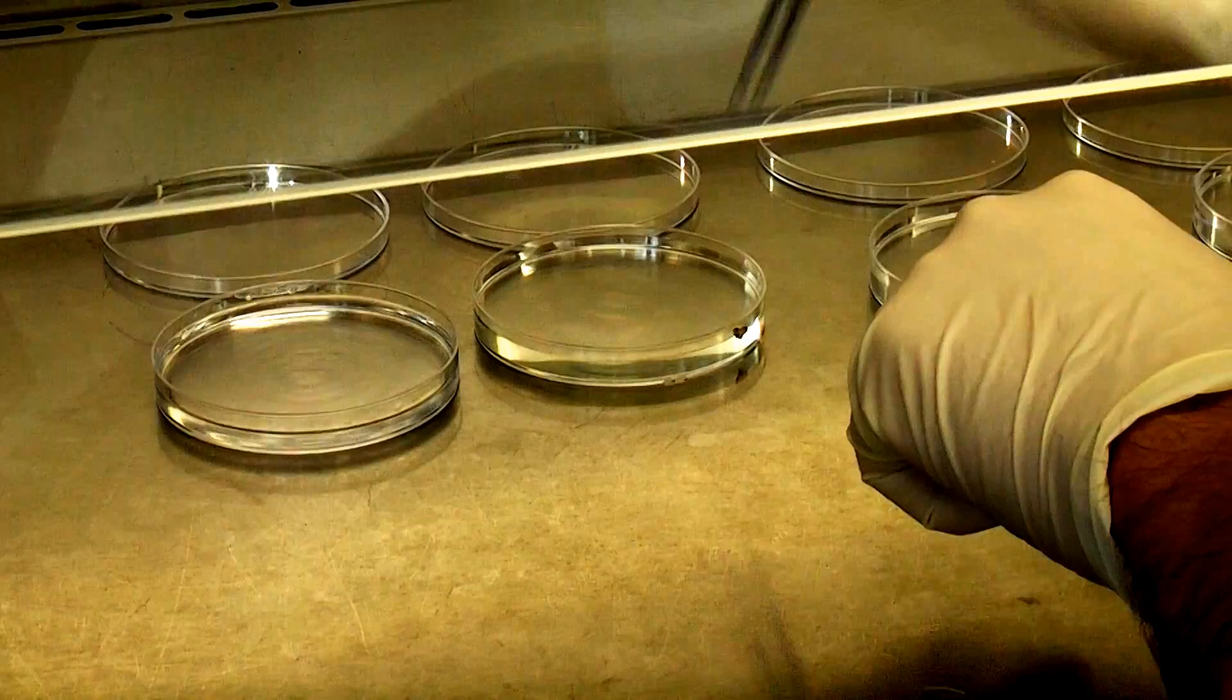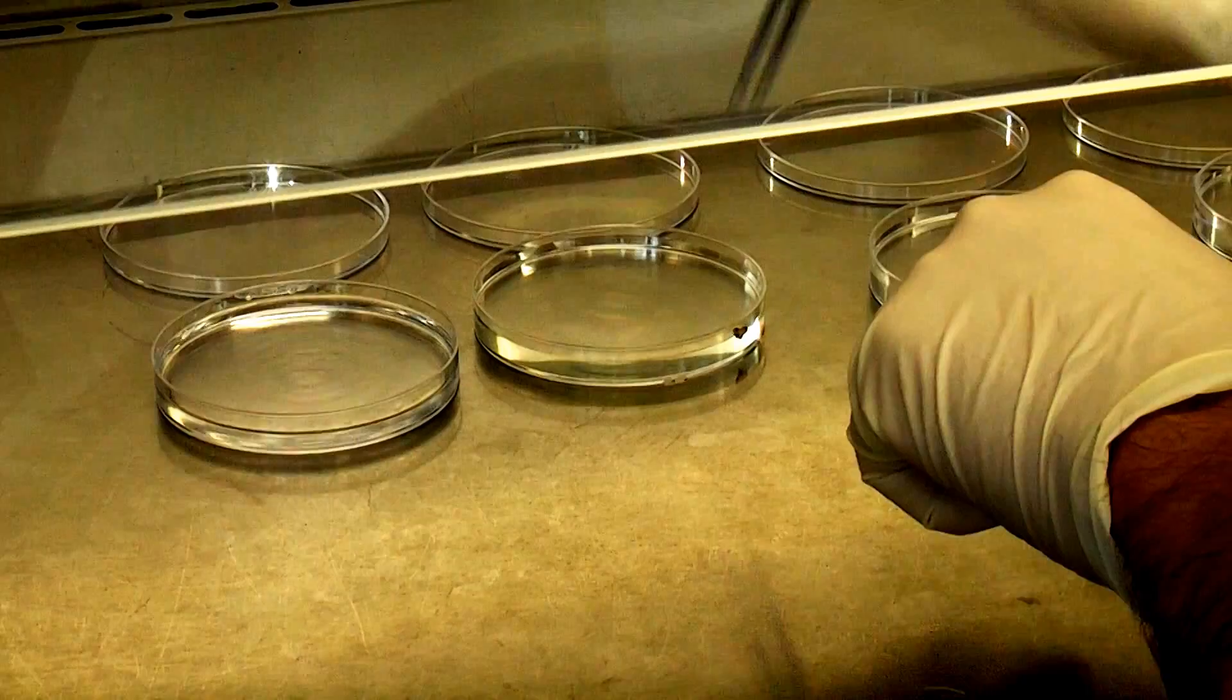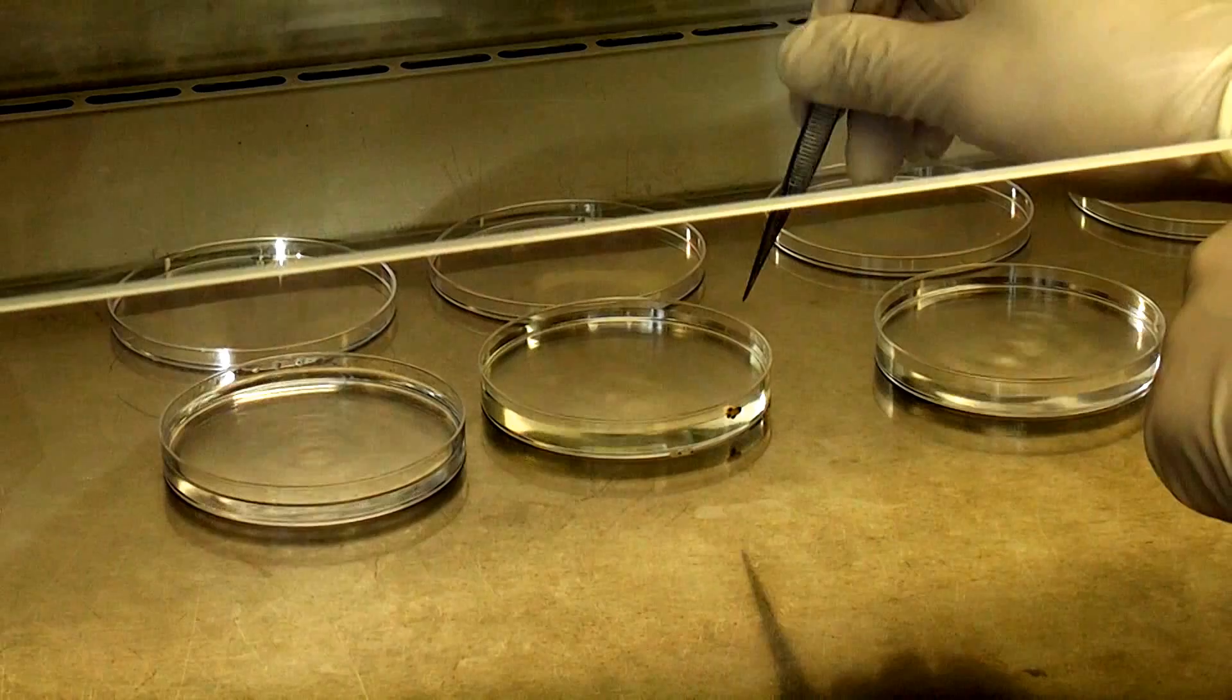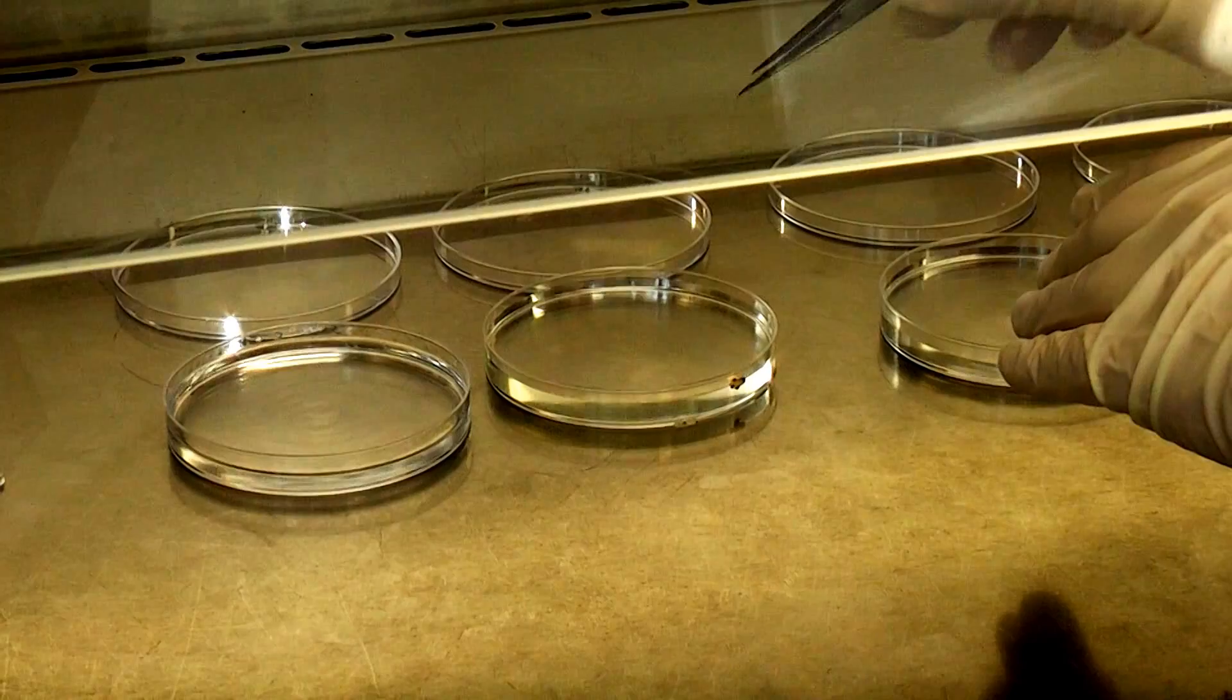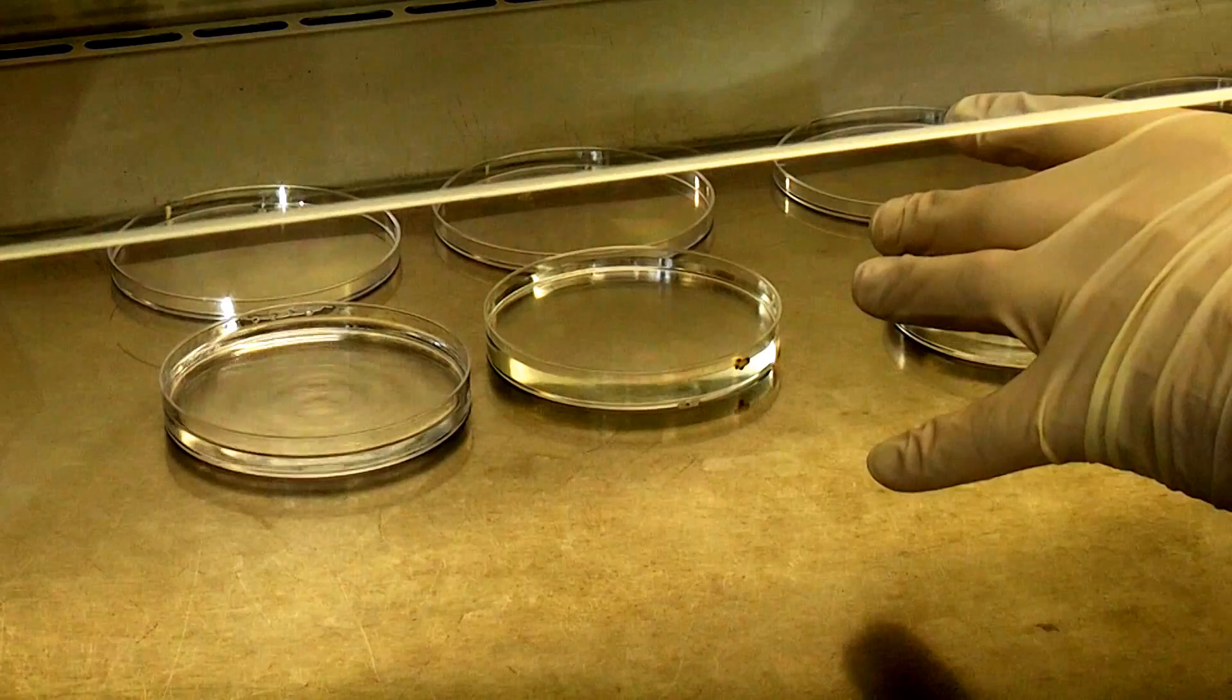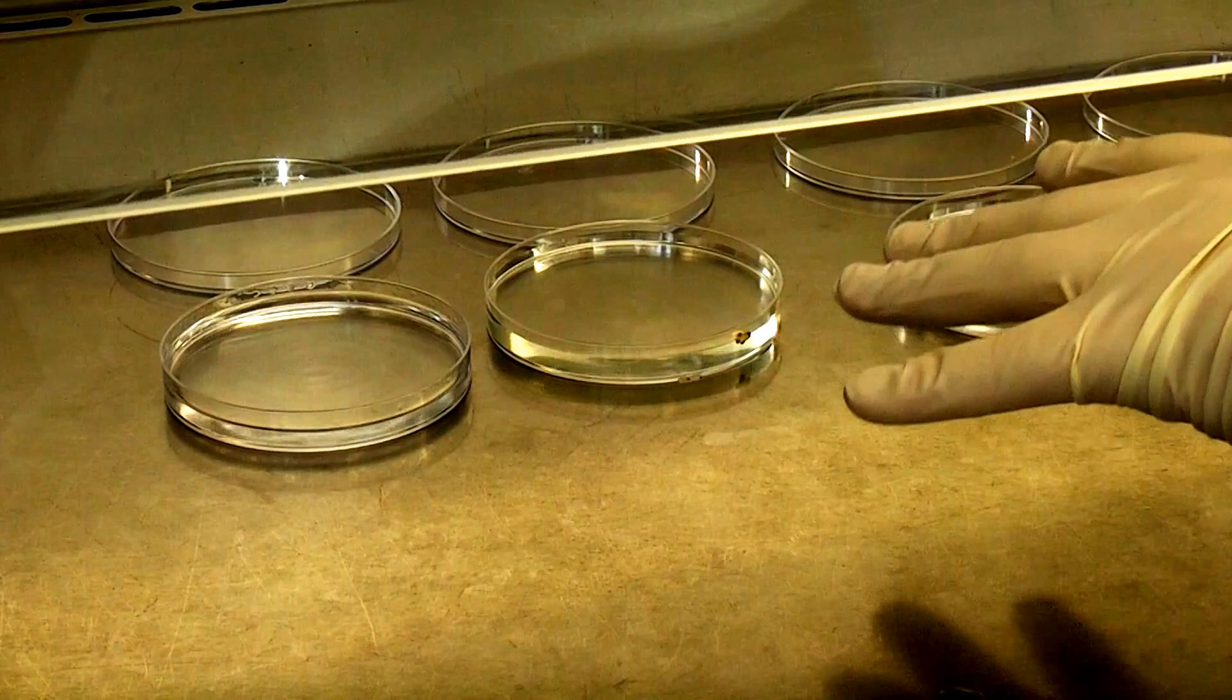By handling it with the root fragment means I'm not touching the nodule itself. Now you don't want to puncture the nodule or anything when you're doing any of this because then it will contaminate all your sterile water. So you want to be as careful with the nodule as you can be, and that'll prevent any contamination and false results in the future. So we can probably turn it off there and I'll come back in 3 minutes when that one has been in the bleach long enough.